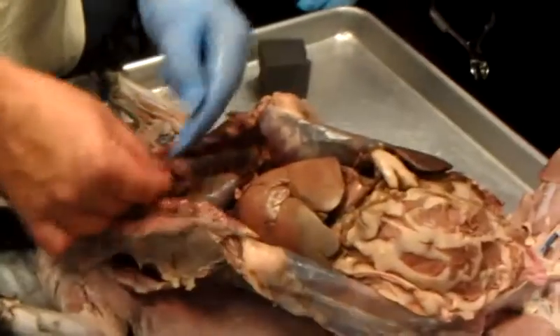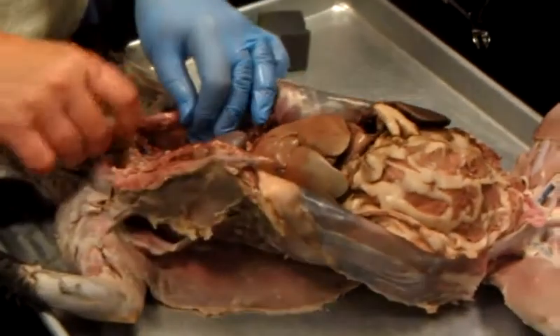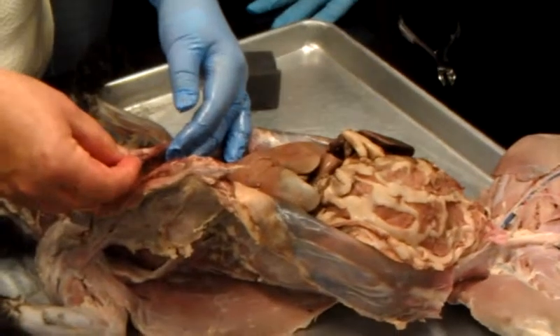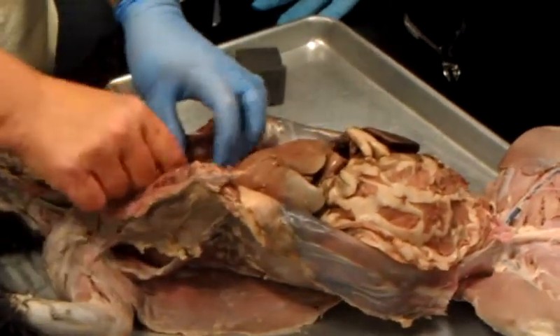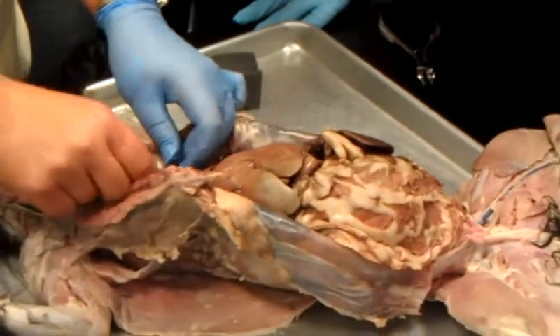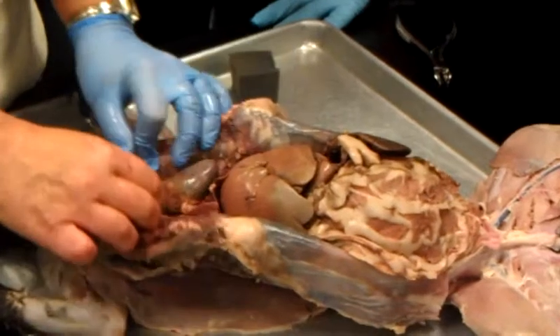So this is your what? Thymus. So in the chest cavity, we don't have a whole lot. We have the thymus. This may be the only thymus we get in the whole room, because it's so nice and trimmed. It's very nice, okay? Pick it off. Get the fat off. Okay, here's your pericardium, right? Parietal pleura, visceral pleura.